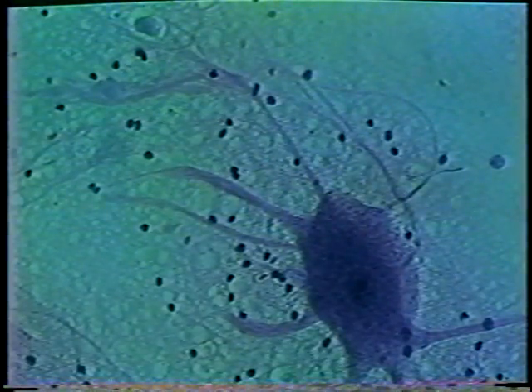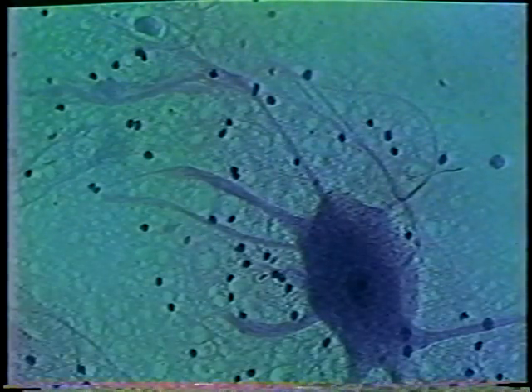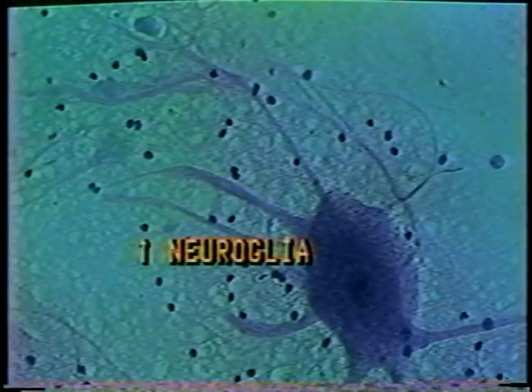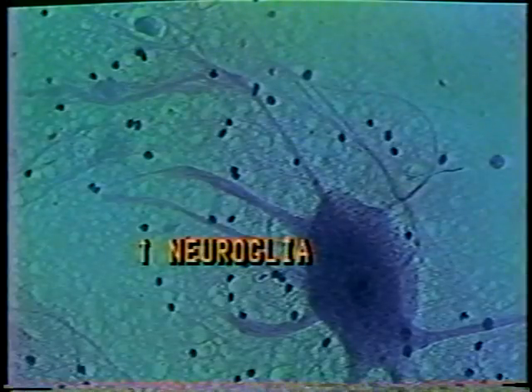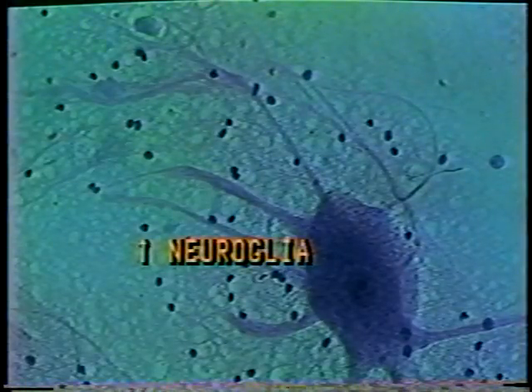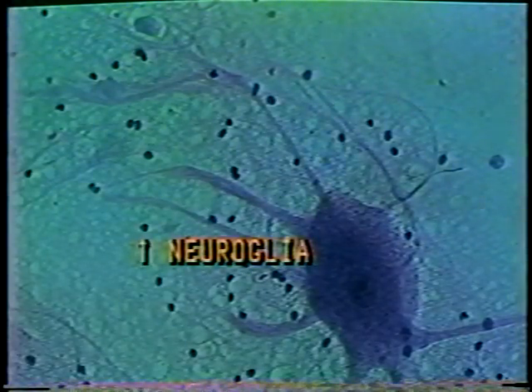Specialized connective tissue cells usually surround neurons and function to support, connect, insulate, and protect these neurons. These connective tissue cells are called neural glia cells or glial cells. As you can see, neural glial cells are much smaller than the neuron and do not share any nervous tissue functions per se. They cannot conduct nerve impulses and are thus not really classified as nervous tissue.